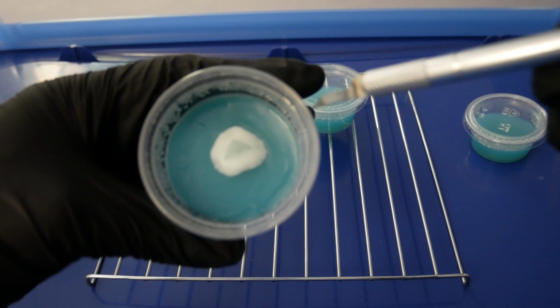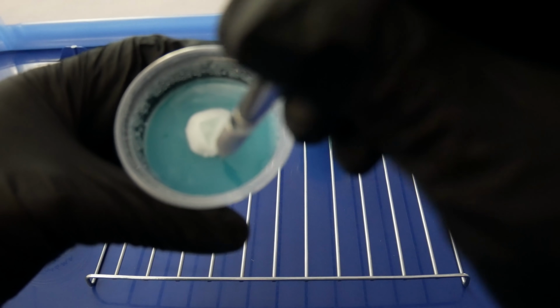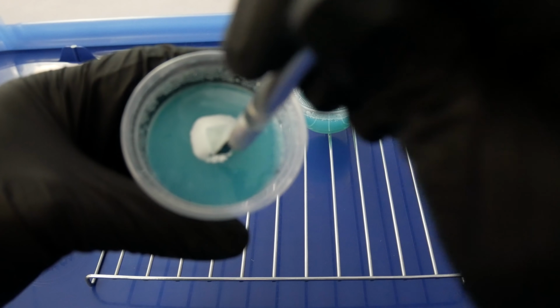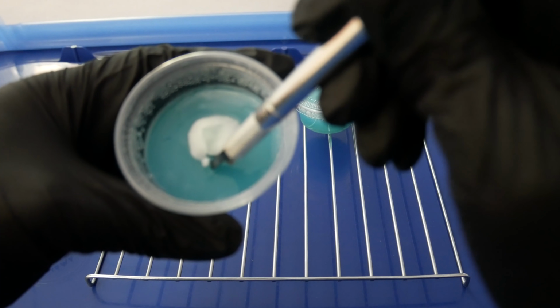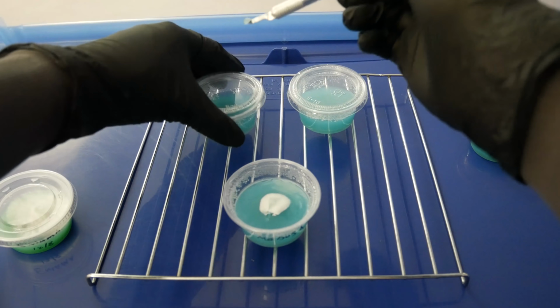But anyways, in here we're trying to look for a spot of mycelium that is not in the goopy mess. So I'll make a selection here that's on a clean looking area on the agar, and then we'll cut this out. Carefully lift this up, and we'll put this onto our new dish.